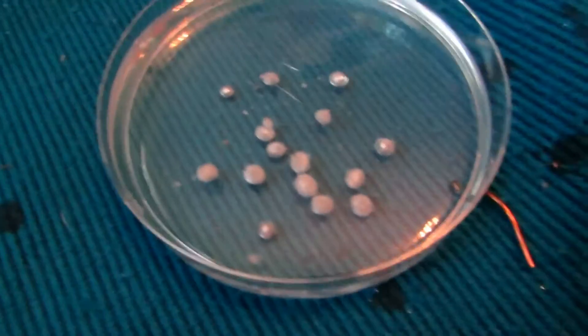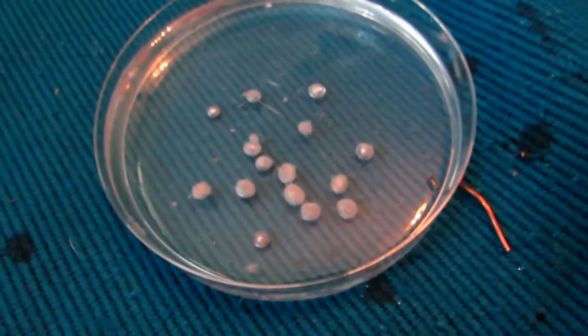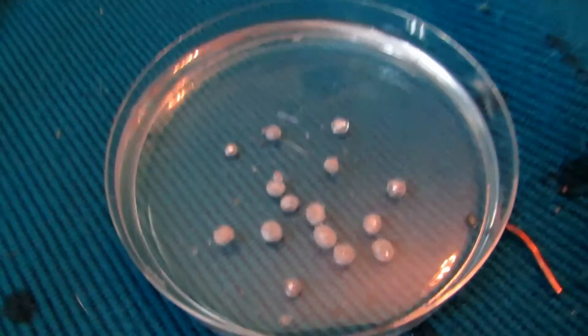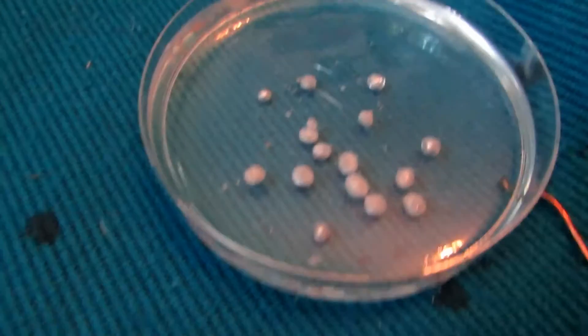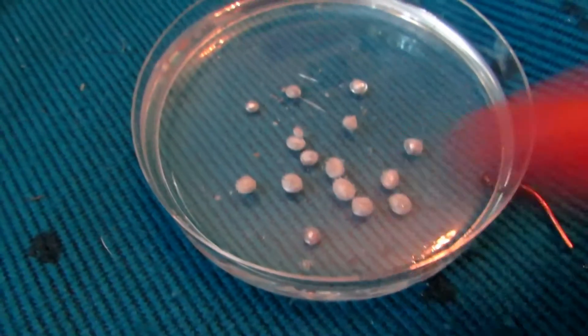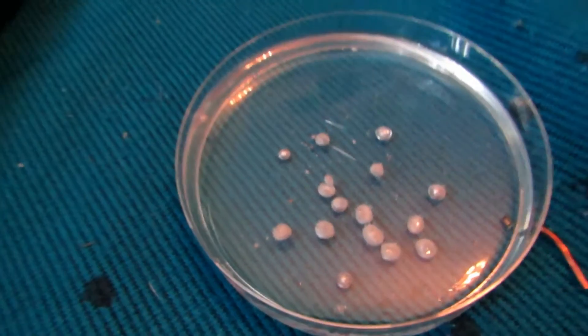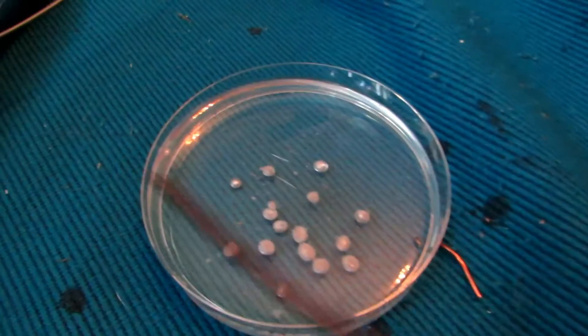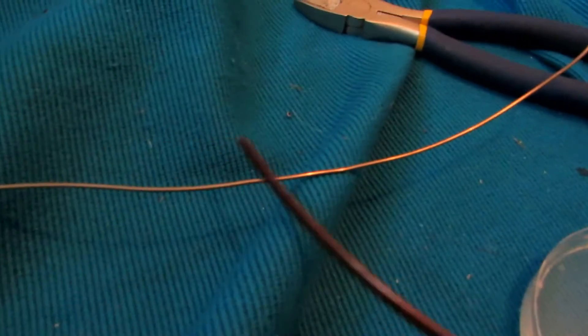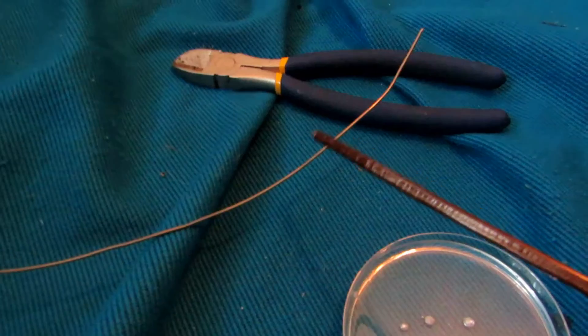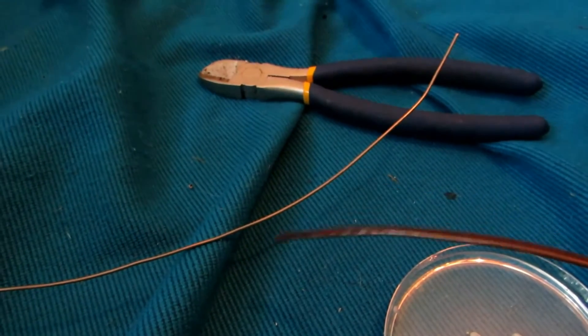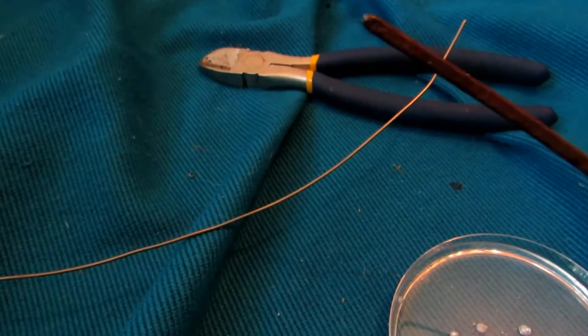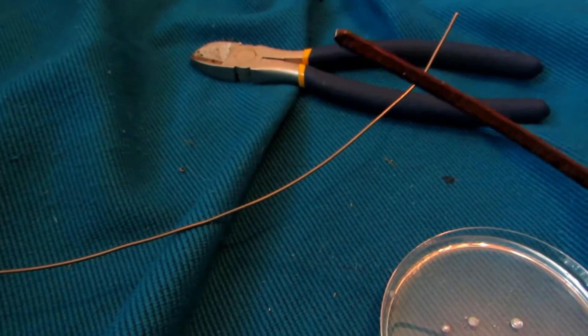Okay, so it was indeed sodium potassium alloy, NaK, and I'm so excited about that. There's all the little drops that we squeezed out of the larger tube. Now the smaller tube, we could save it because it's pretty cool when you tap the end or hit it or drop it in water or something, but it's not really of any use.